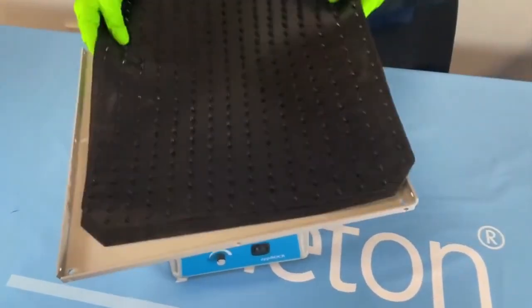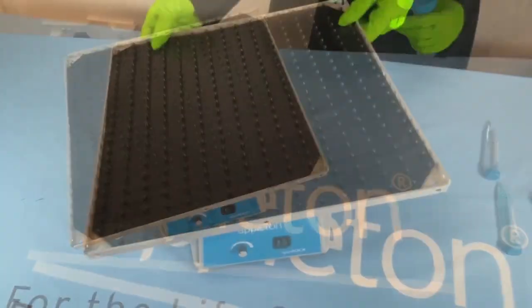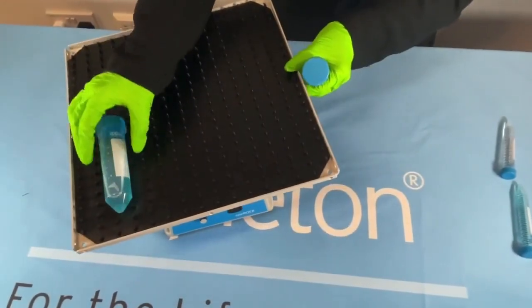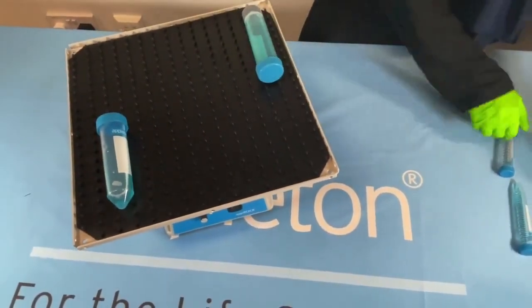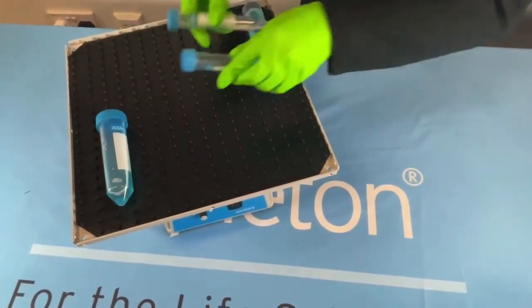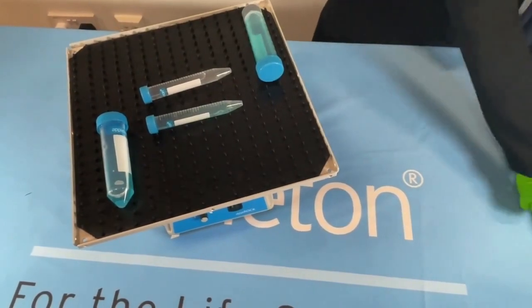Once the desired tilt angle has been selected, simply place the mat back onto the platform. Place your samples onto the platform ensuring a balanced load.